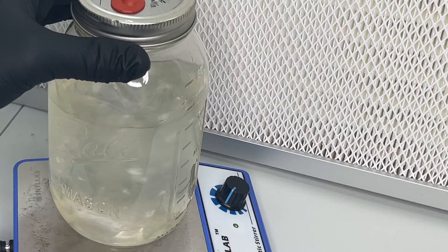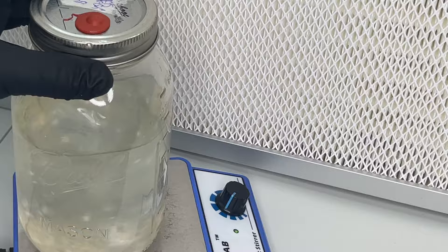Once the jar is full of mycelium, you can place it inside of a cold room where it should stay viable for around 12 months.